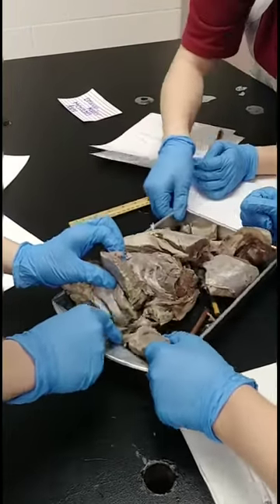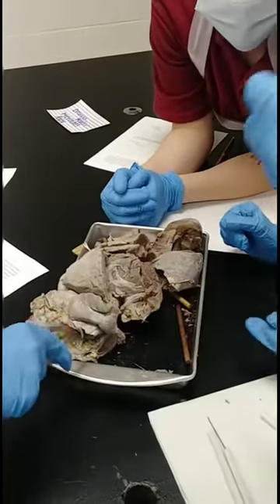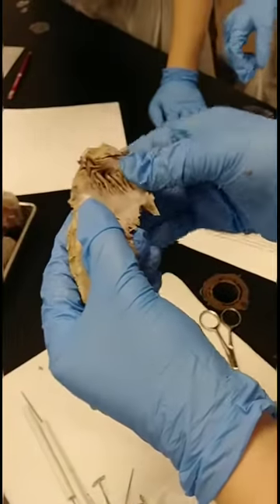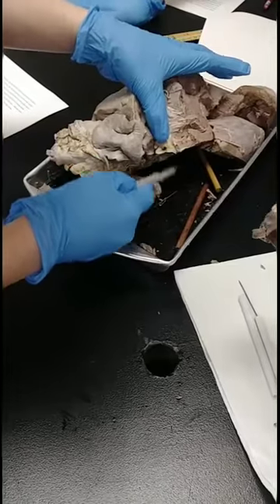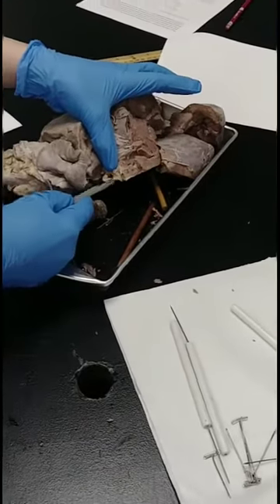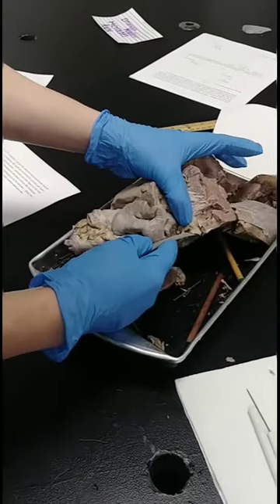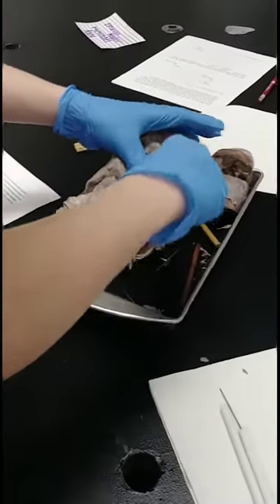Look at this — there's a little valve. Oh look, there's blood! That's the valve. See that? When you squeeze it, the blood comes out. It's blood. Cut it open.